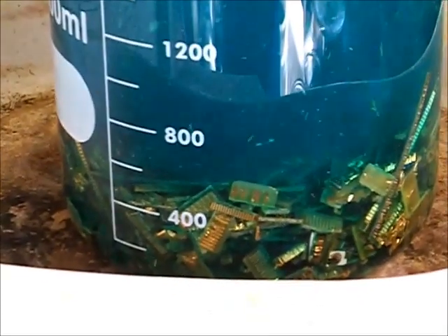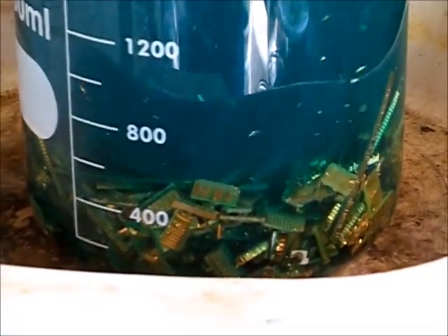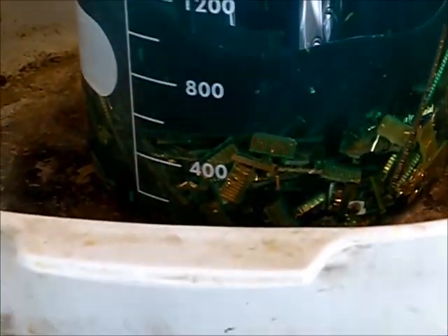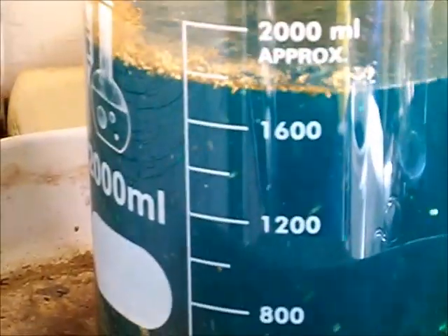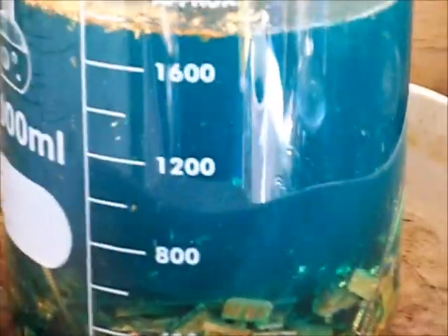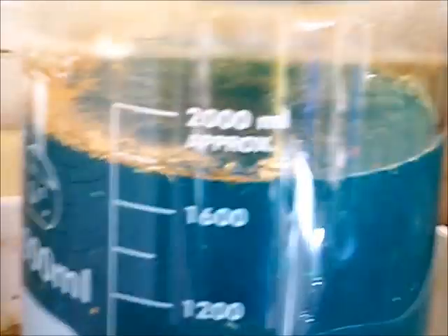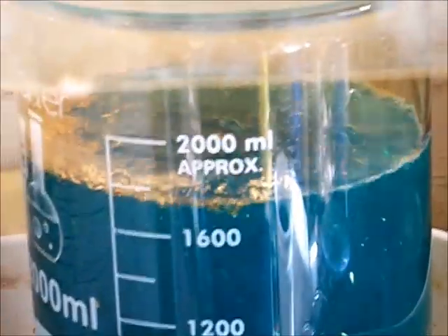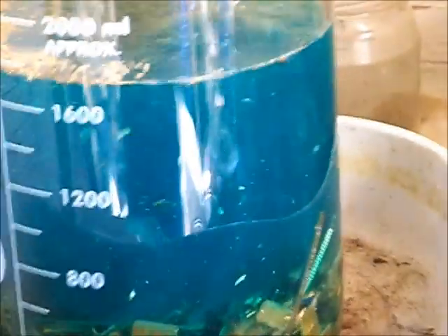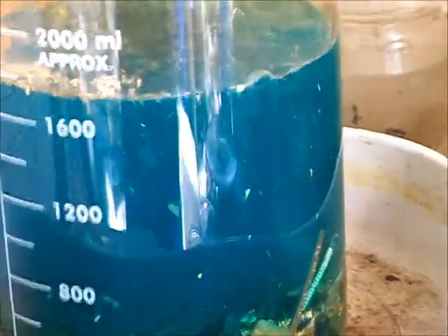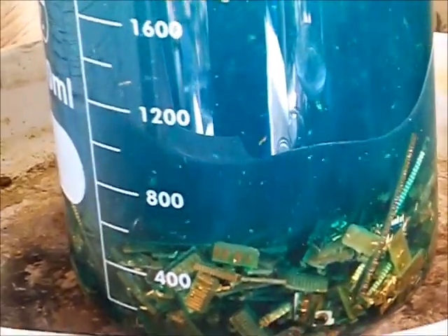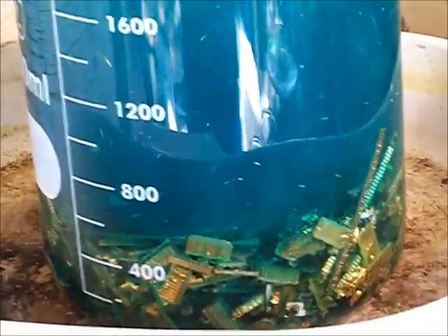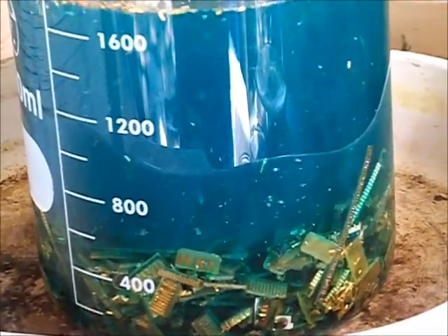It's basically just a solid nitrate salt and sulfuric acid and tap water and of course your material. It works for any gold plated material, anything that nitric acid will dissolve. This will dissolve copper, brass, bronze. It will dissolve stainless steel, magnetic material. Basically anything that nitric acid will dissolve. I think it even dissolves the nickel because of the sulfuric acid, so that's an added bonus.